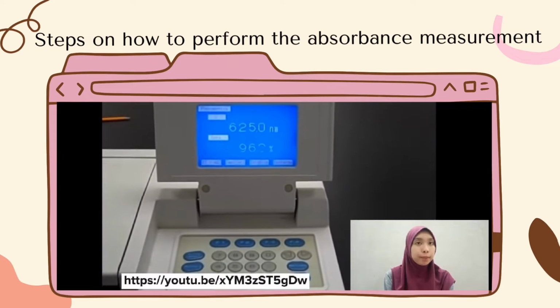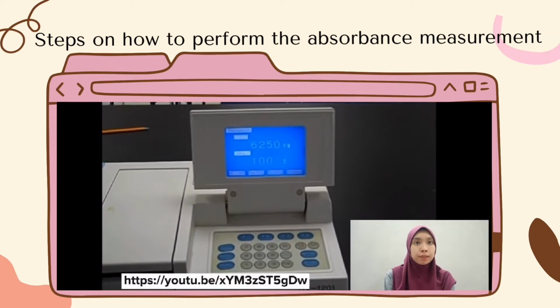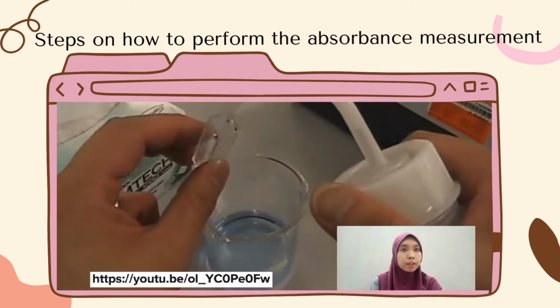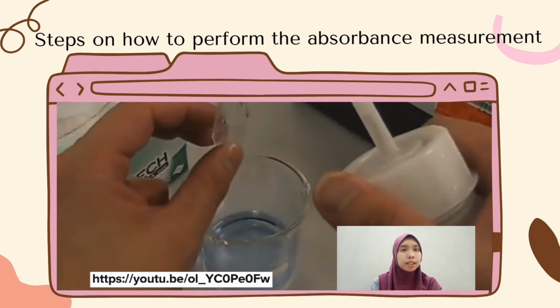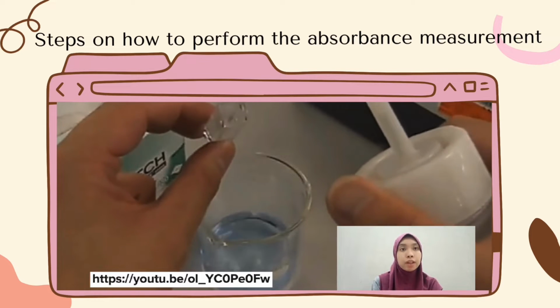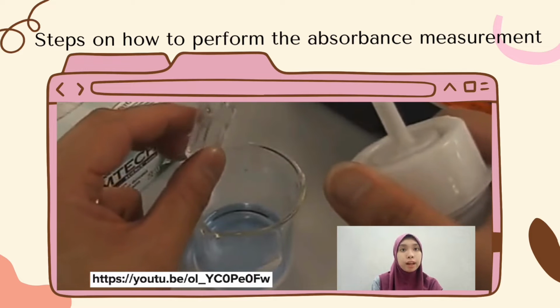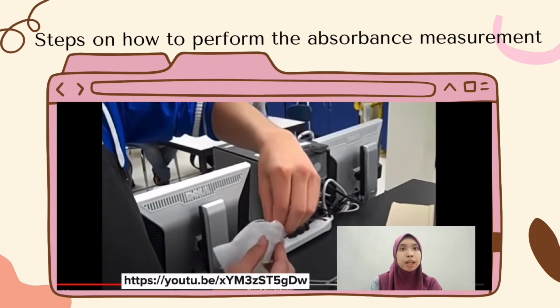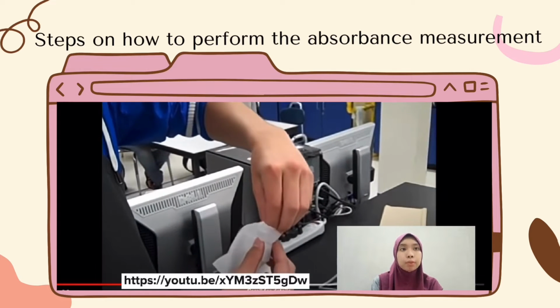The spectrophotometer was turned on at least 15 minutes before the experiment started. The cuvettes and test tubes need to be cleaned first using deionized water. Basically, cuvettes are made of quartz since they function for UV-visible in the spectrophotometer. Handle them with care to prevent any damage. The cuvettes are wiped with a Kimwipe to prevent any scratching of the glass that will disturb the results of the experiment.